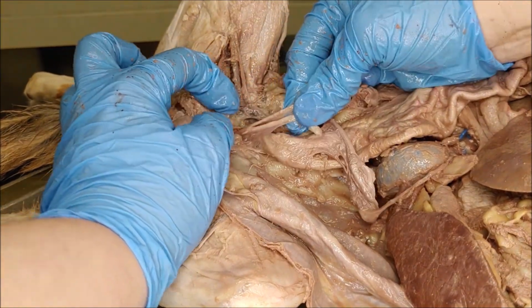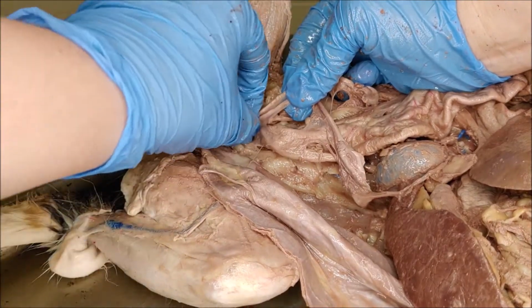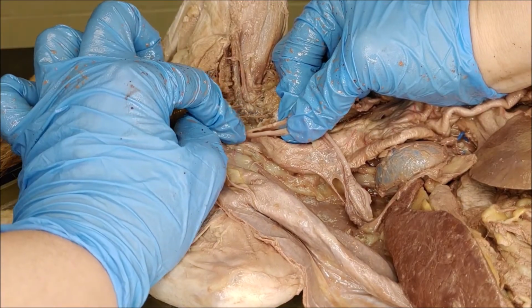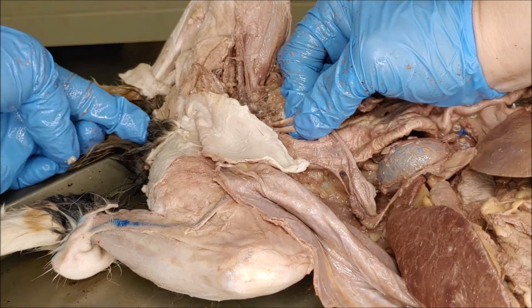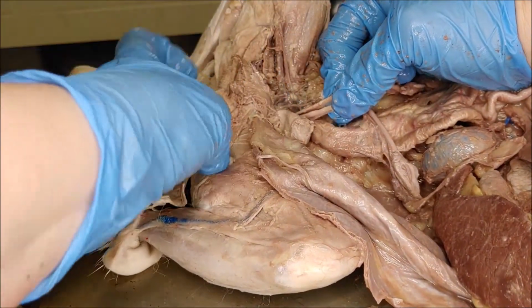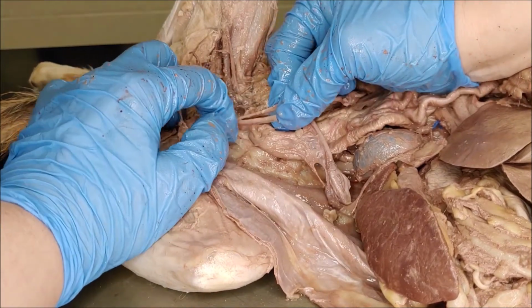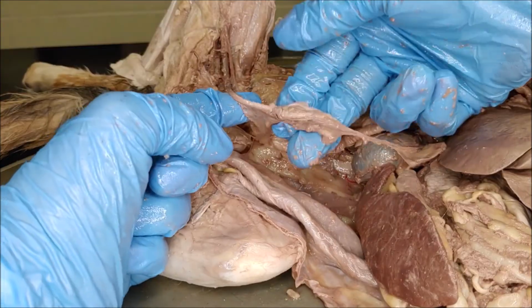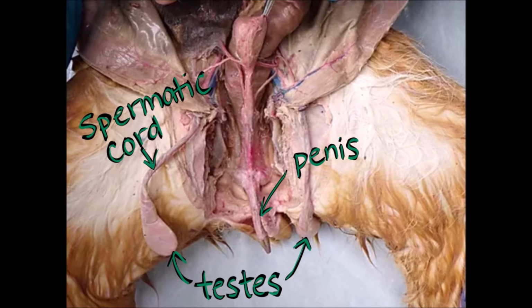Where the horns of the uterus come together is called the body of the uterus, and then separating the uterus from the vagina is the neck of the uterus called the cervix. The vagina is inside the body, and then the urogenital opening of the cat is the outside opening. So the vagina is an internal structure of the cat, separated from the uterus by the cervix, and then up here are the ovaries. So the body of the uterus is where those uterine horns come together.